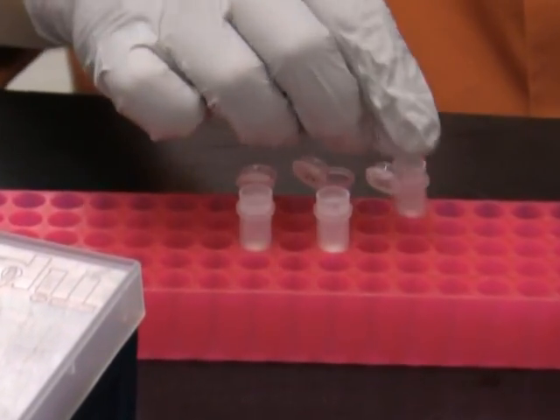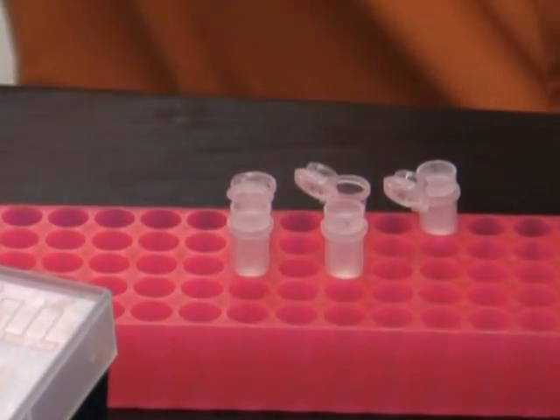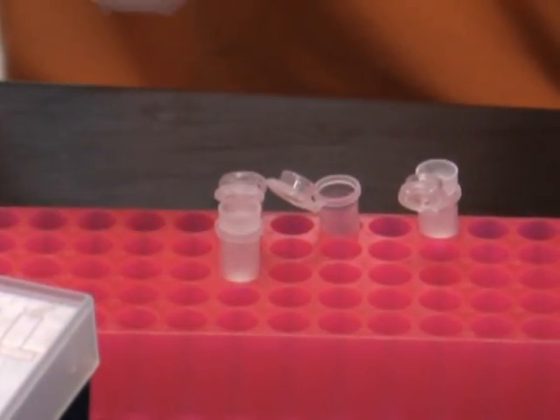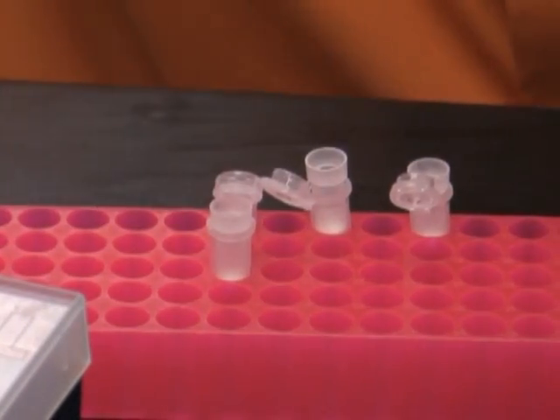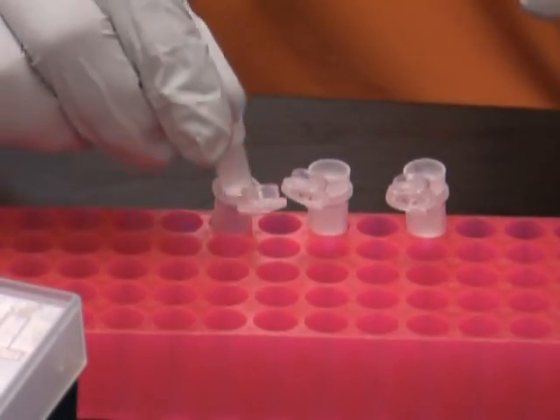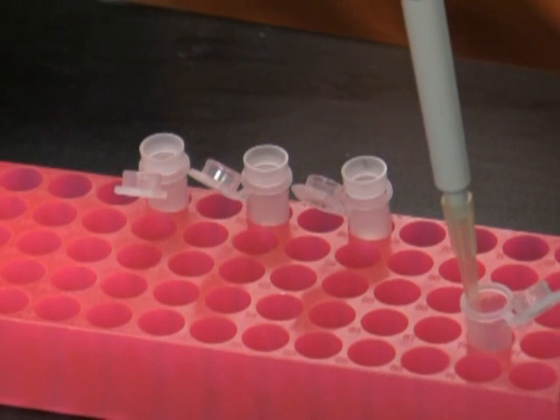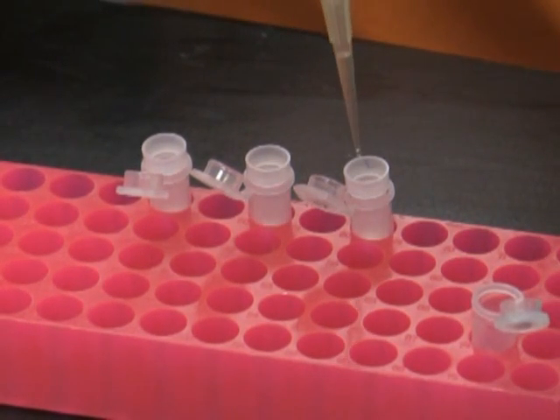Then I transfer the columns into fresh Eppendorf tubes and elute the plasmid DNA from the columns with 100 microliters of double distilled water.